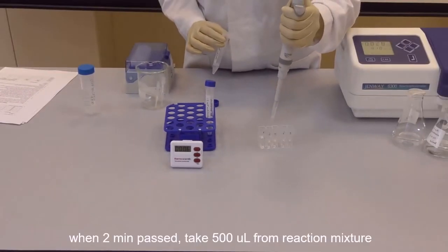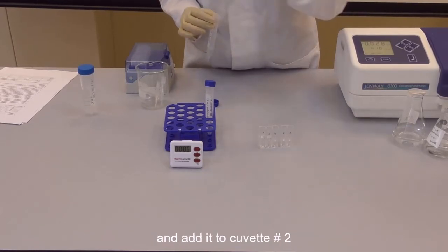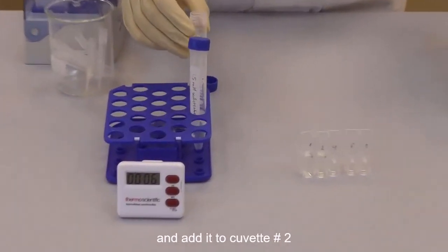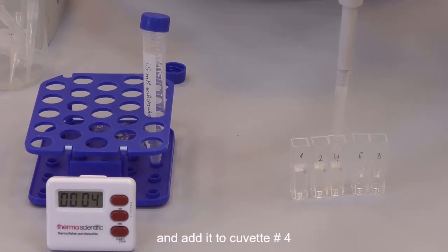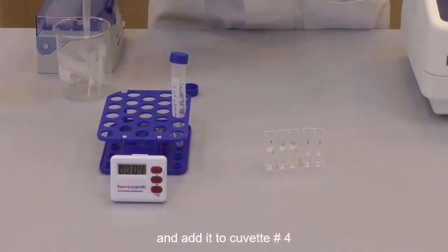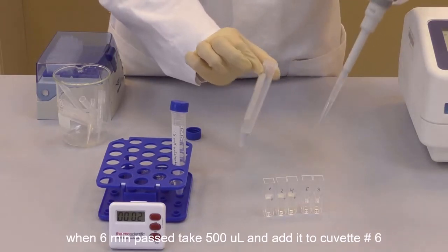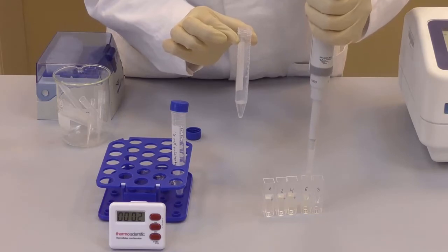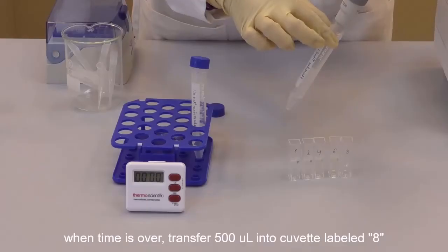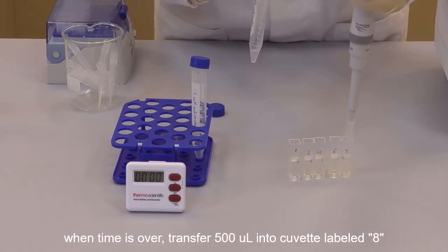When 2 minutes have passed, take 500 microliters from the reaction mixture and transfer it to the cuvette labeled 2. After 4 minutes, take 500 microliters and transfer it to the cuvette labeled 4. At 6 minutes, take 500 microliters and transfer it to the cuvette labeled 6. When the timer is over, transfer 500 microliters into the cuvette labeled 8.